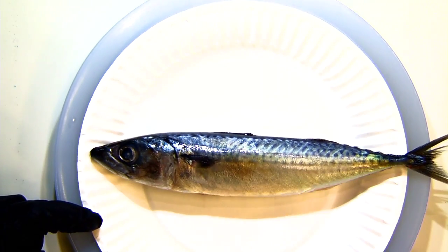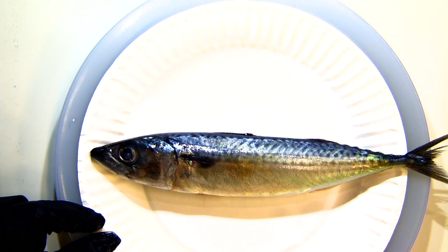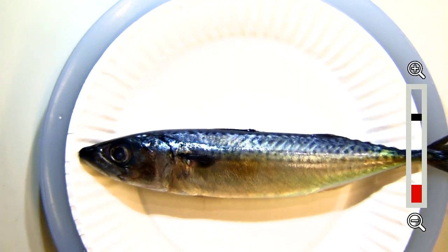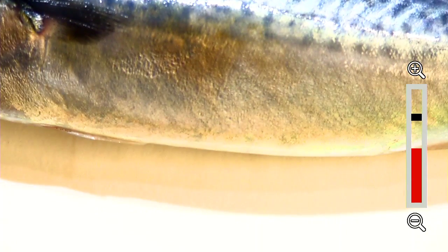So we know fish have fins. What else do you notice? Another fish characteristic - you might think about the scales. The scales on a mackerel are much, much smaller than some other fish. Their scales are so small it actually gives them a velvet feel, so when you touch a mackerel it feels very smooth. You don't really feel those individual scales because they are so tiny.